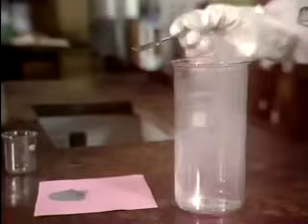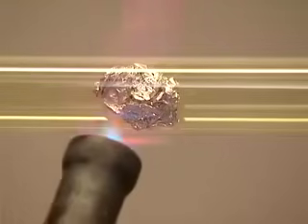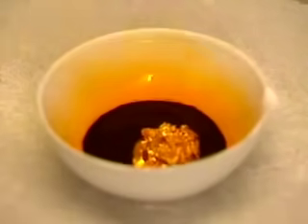Now let's see how the halogens react with aluminium. When aluminium powder meets fluorine gas, the reaction is over in a flash. To get chlorine to react with aluminium, I'll heat some foil in a stream of the gas. The white fumes are aluminium trichloride. With bromine, I just drop aluminium foil into the liquid. There's a short delay, but normal service is soon resumed. Once the reaction gets going, it quickly takes on the appearance of the pit of hell. As with the chlorine reaction, there's white smoke — that's aluminium tribromide.